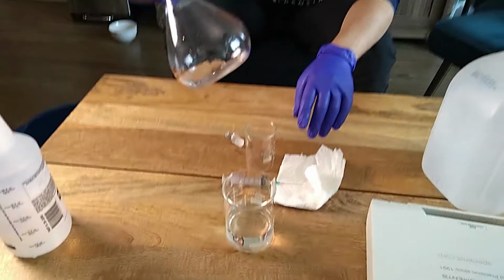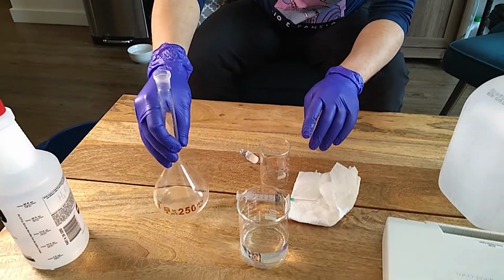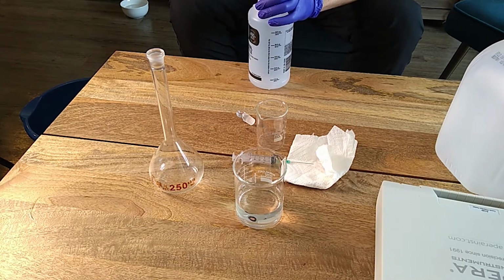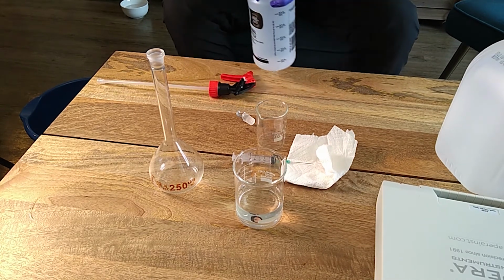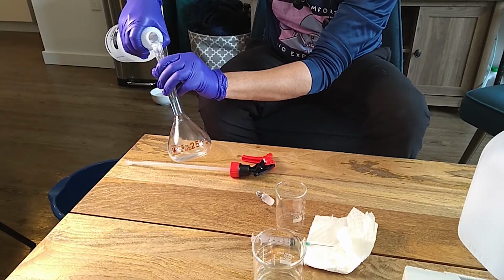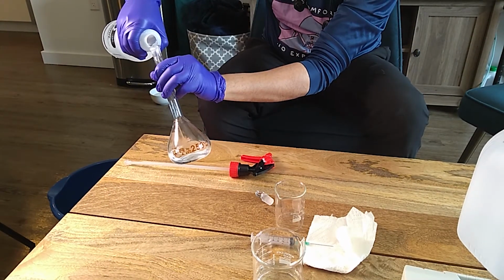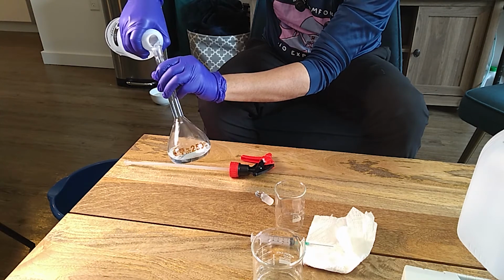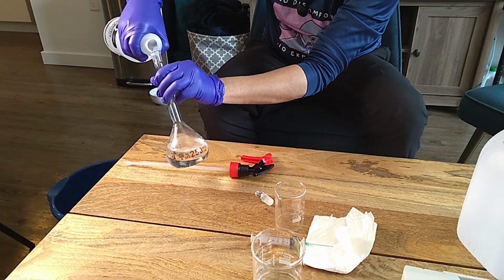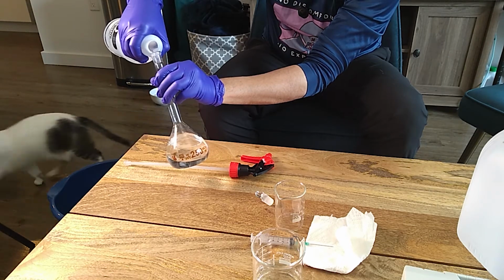Now we have the volume here, and now we're going to fill this up the same way we did last time. So I'm going to just fill it. Pretty shaky today.